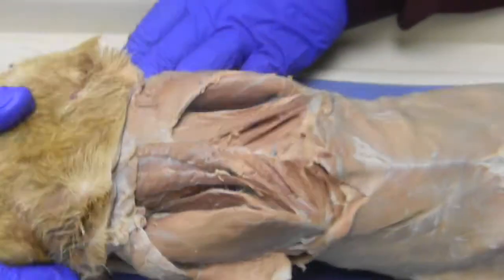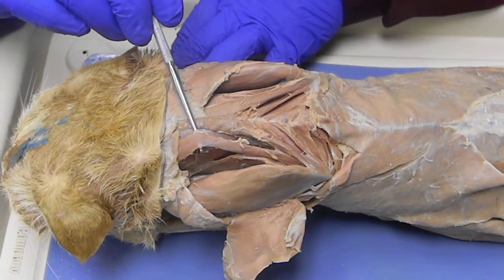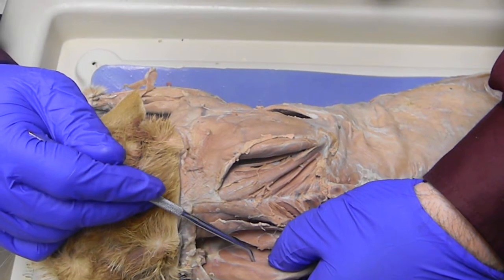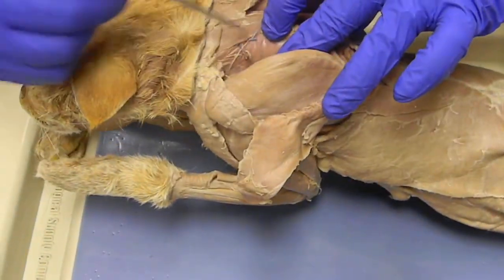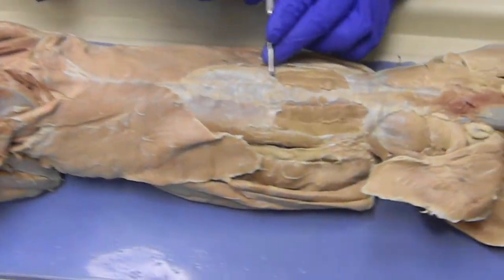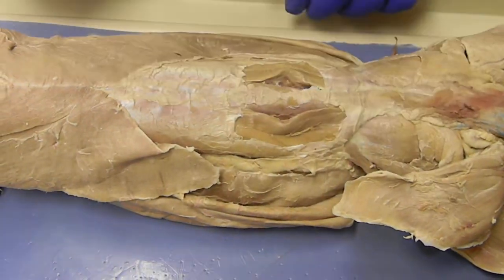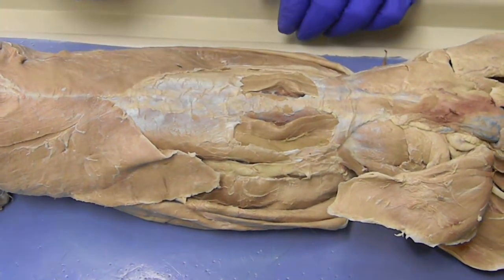Put them in the praying position. That rotates out the rhomboids. The one that goes up to the head is the rhomboideus capitis. The muscle on the back of the scapula is the subscapularis. The muscle that's on the neck still, right here, is the splenius. We have the thoracolumbar fascia. We separated the muscles of the back into two groups, the multifidus in the middle and the erector spinae on the side.